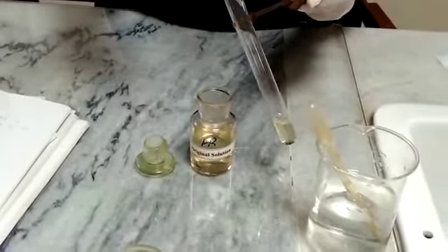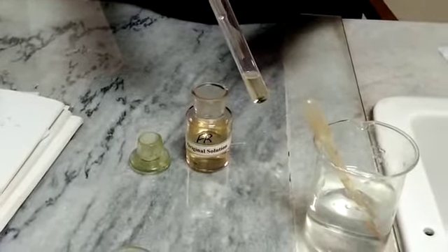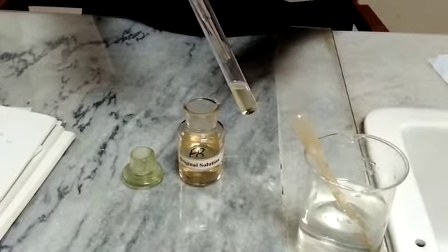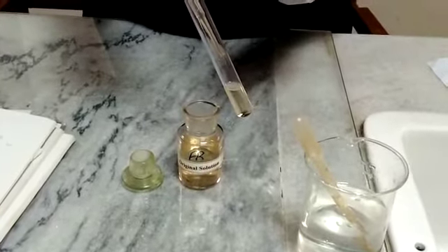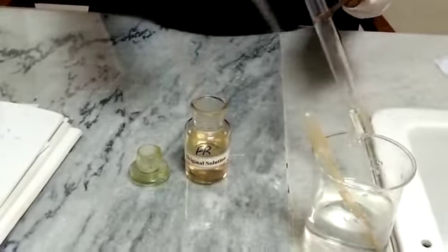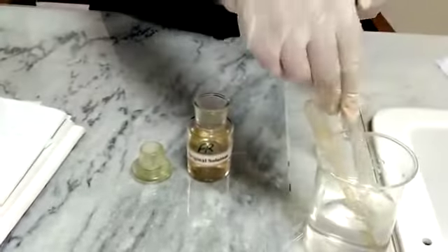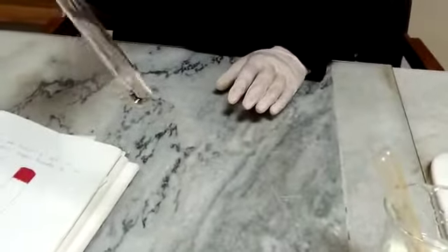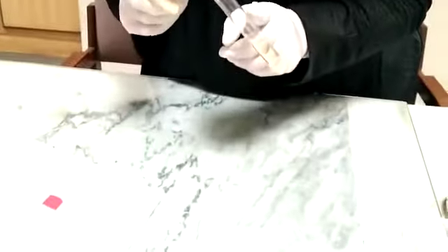Now for the original solution, about 10 drops are being added into the test tube: 1, 2, 3, 4, 5, 6, 7, 8, 9, 10. This is thorough mixing. Now we will heat and boil the solution over a direct flame.